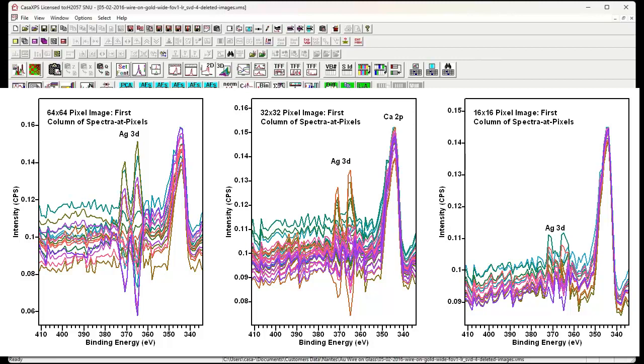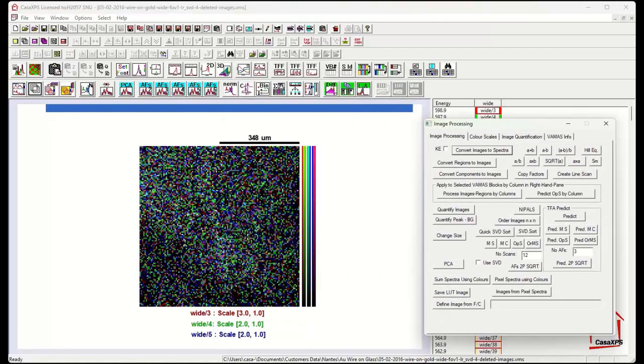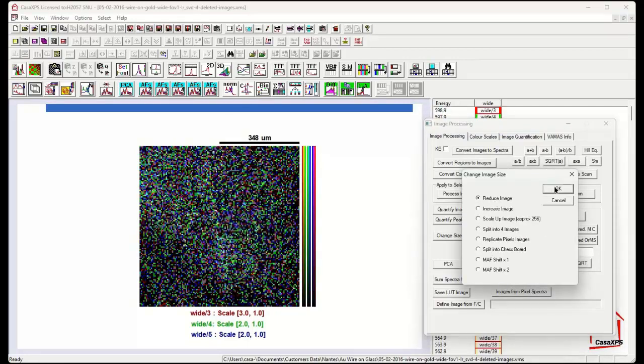Perhaps we can't see it so well in the positive going peaks. But the point is that the calculation performed on data of this form does have limitations. I can simulate what would happen if I'd spent more time collecting these data, and I can do that by using a mechanism by which pixels are summed to produce more intensity but fewer pixels. This is done on the image processing dialog window, the image processing property page, using the change size button. So all the images overlaid in the active tile, I use the reduce image option and press OK.